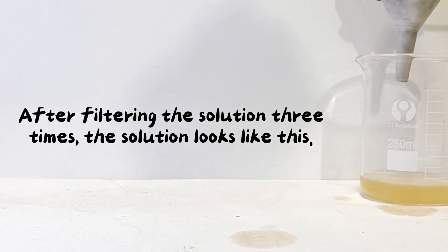One hour later, after filtering the solution 3 times, the solution looks like this.